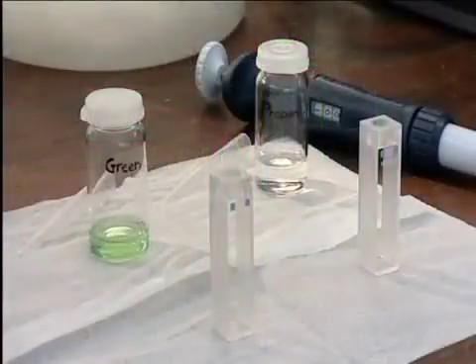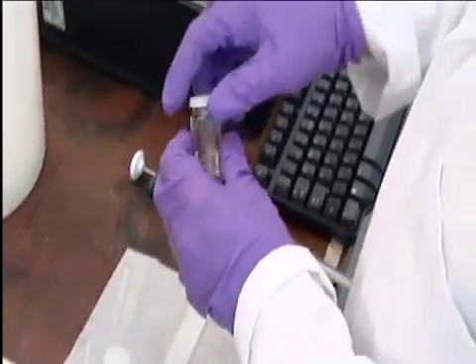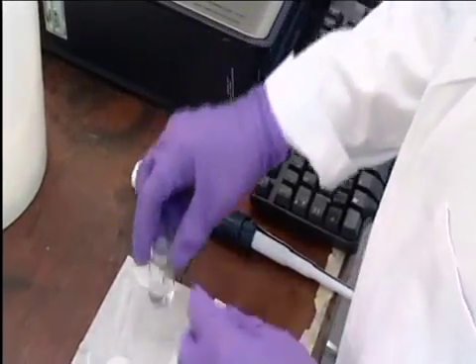Ultraviolet visible spectra are usually run on solutions. Light does not normally pass through solid samples. Here, we will run the spectrum of a green food dye.